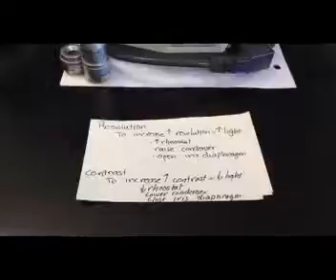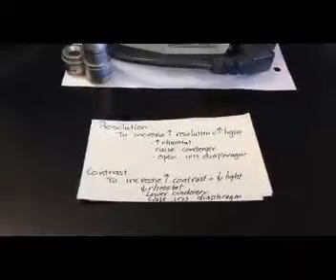And to increase resolution, we want to increase the amount of light that strikes the specimen and then works its way through the lens system and strikes our retina. Each photon of light which strikes the retina will generate an action potential, basically pieces of data that then travel back to the visual centers of the brain. And our brain will use those action potentials, those data points, to create the image of the object that we see. So the more light that strikes a specimen and eventually strikes the retina, the more data points our visual center has, and the clearer the image the brain can create for us. So to increase resolution, we want to increase the amount of light that strikes our specimen.